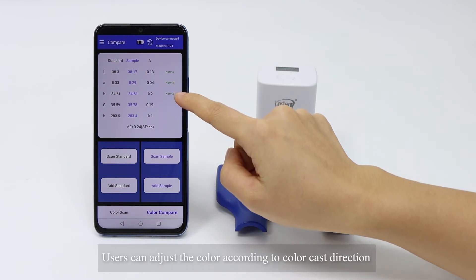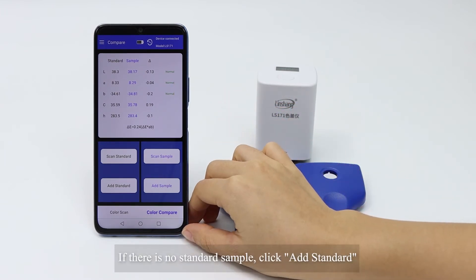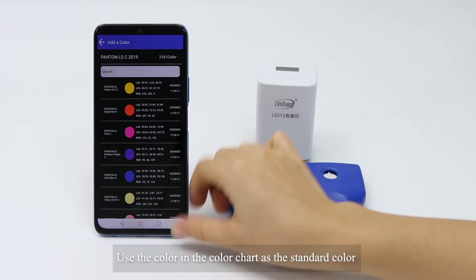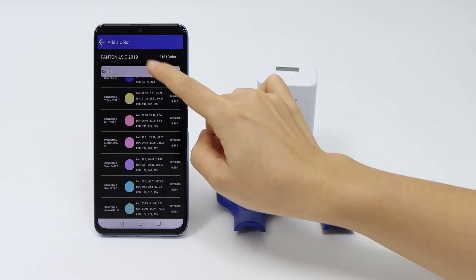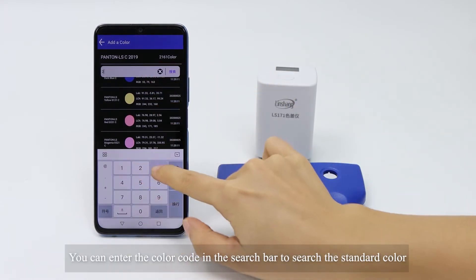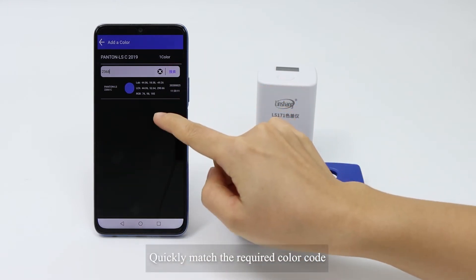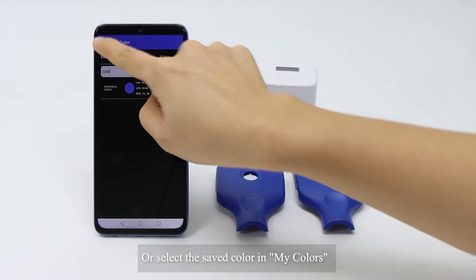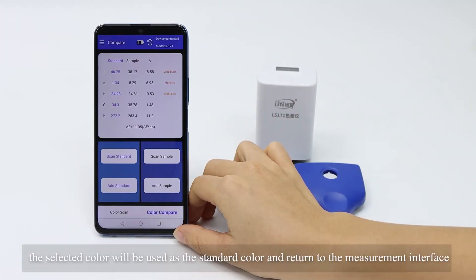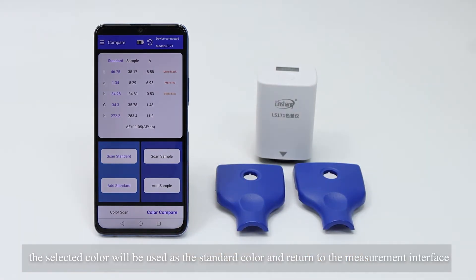Users can adjust the color according to the color cast direction. If there is no standard sample, click Add Standard to use a color from the color chart as the standard color. You can enter a color code in the search bar to find the standard color, or select a saved color in My Colors. Click the color you want, and it will be used as the standard color, returning you to the measurement interface.